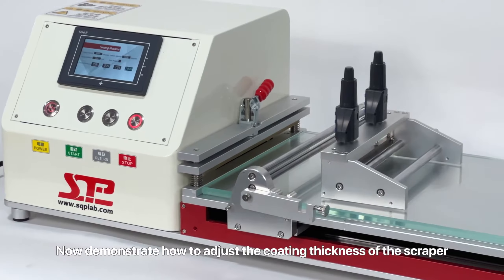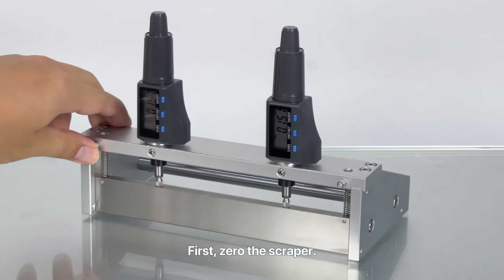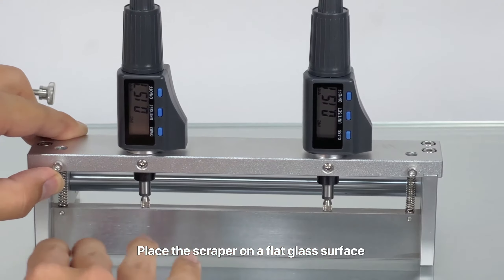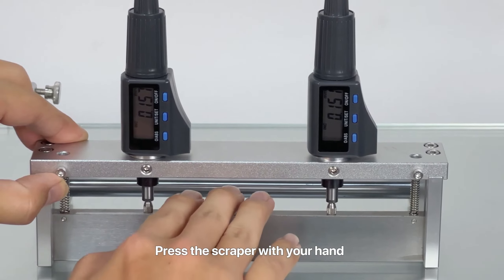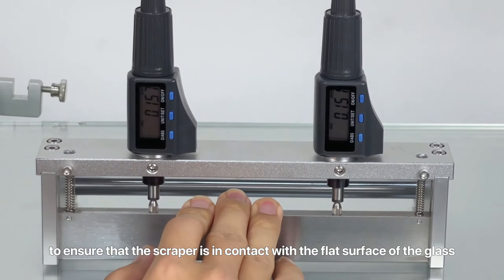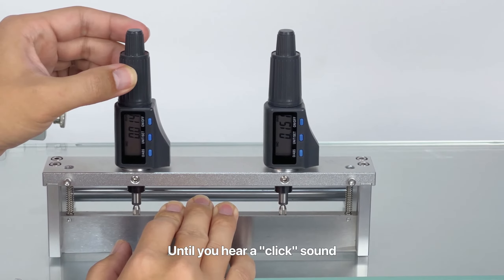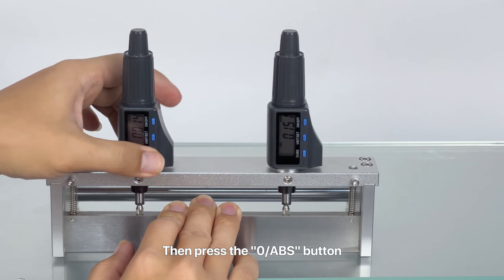Now we demonstrate how to adjust the coating thickness of the scraper. First, zero the scraper. Turn on the digital micrometer. Place the scraper on a flat glass surface and press it with your hands to ensure contact with the flat surface. Then turn the larger knob of the micrometer until you hear a click sound, and press the zero ABS button.